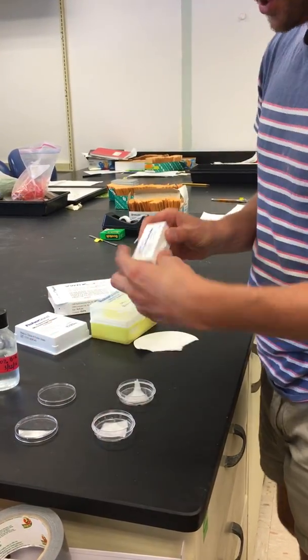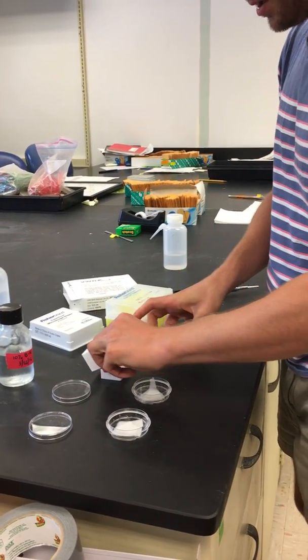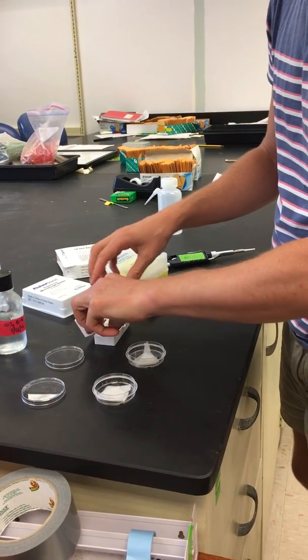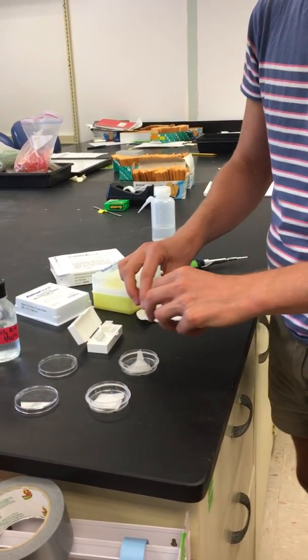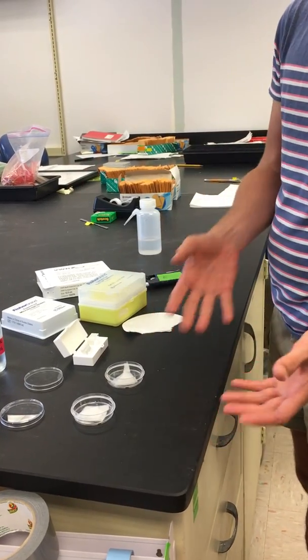Then you take your microscope coverslip and place one in each of your petri dishes. So one petri dish will have one sample on top of the moist filter paper.